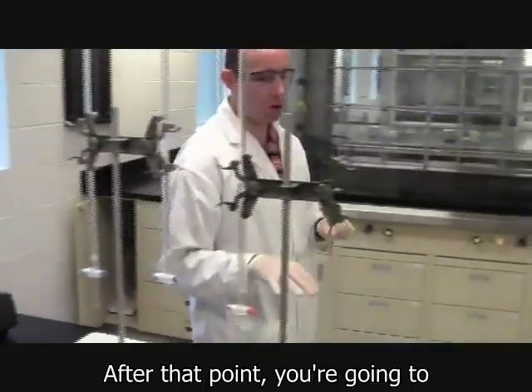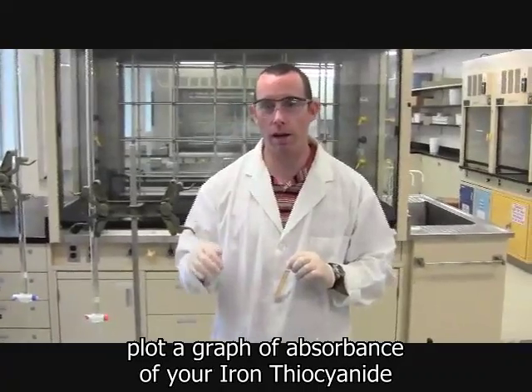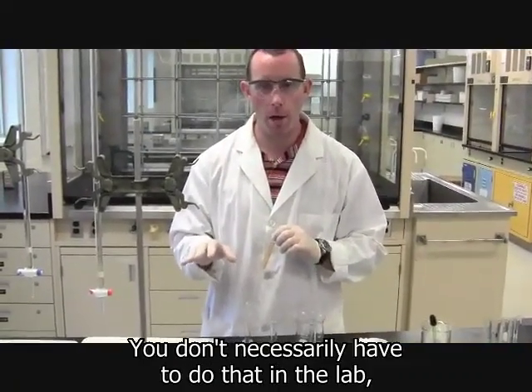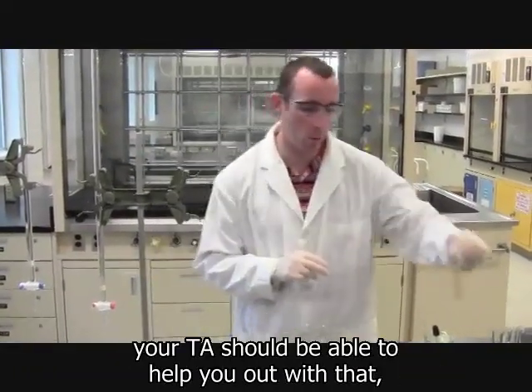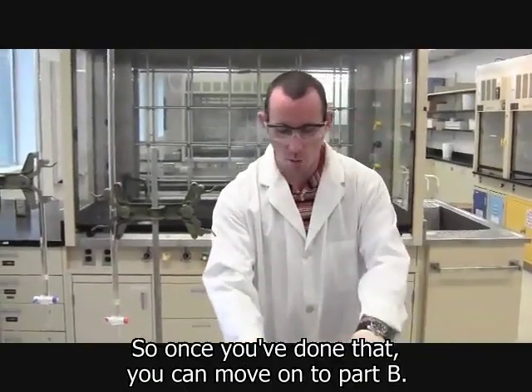After that point, you're going to plot a graph of absorbance of your iron thiocyanate against the concentration, which you'll calculate. You don't necessarily have to do that in the lab. Just make sure you look at your data and it looks like a nice linear trend. Your TA should be able to help you out if you're unsure if your data is correct or not. Okay? So once you've done that, you can move on to part B.